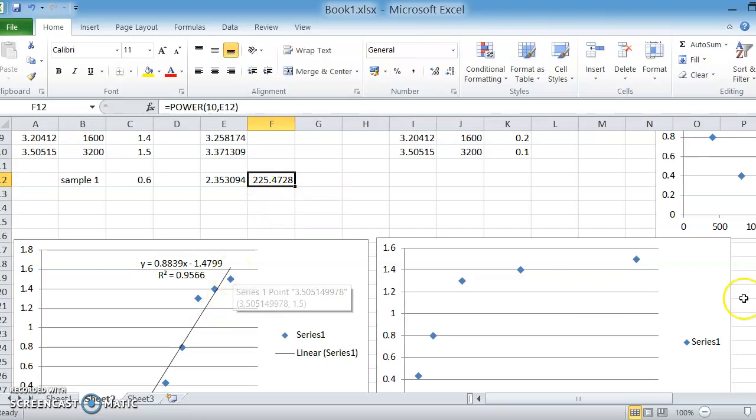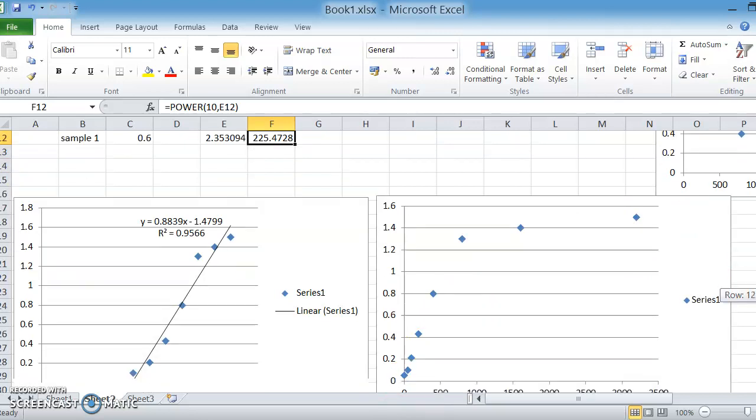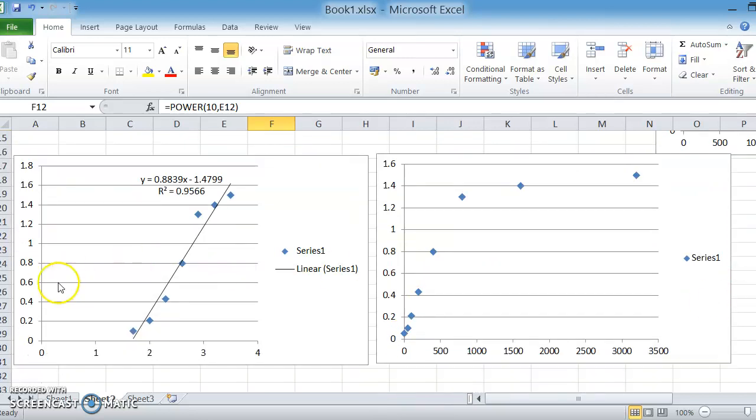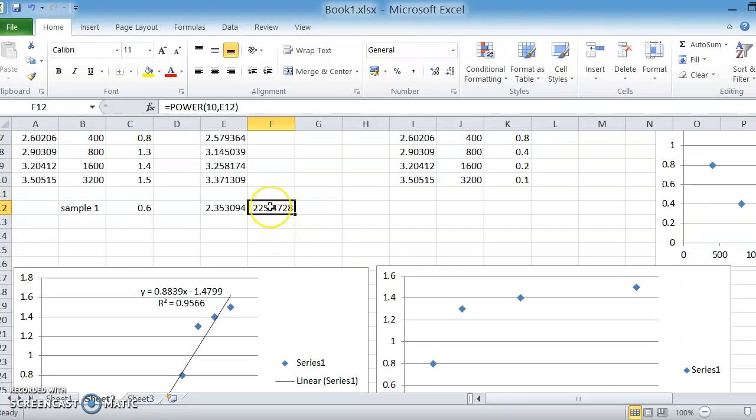So what we've effectively done here is taken data that looks like this, done logarithms of that, so we've got this straight line graph. We've then read off our values from here by importing our absorbance into this equation to find out what x is. So we've put in absorbance of 0.6, rearranged this equation. That is equivalent to drawing a line across and drawing downwards. That gives us 2.35, but then we need to convert the 2.35 back into the actual concentration. So that's why we've effectively gone 10 to the power 2.35. If it was 10 to the power 3, it would be 1,000. 10 to the power 2 would be 100.